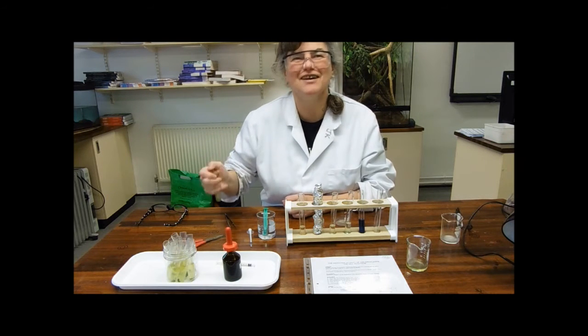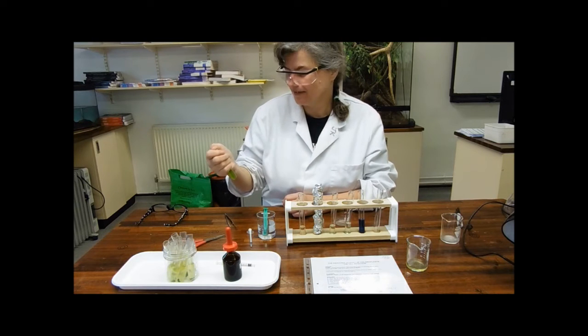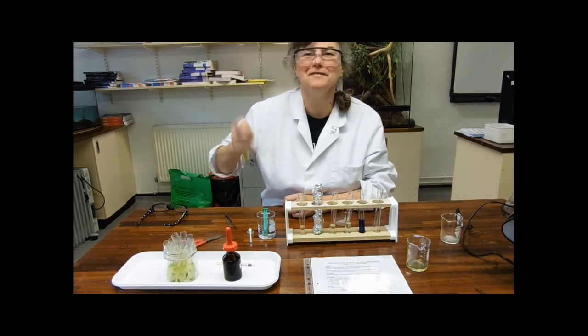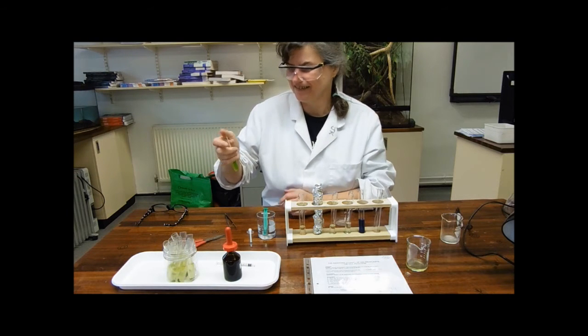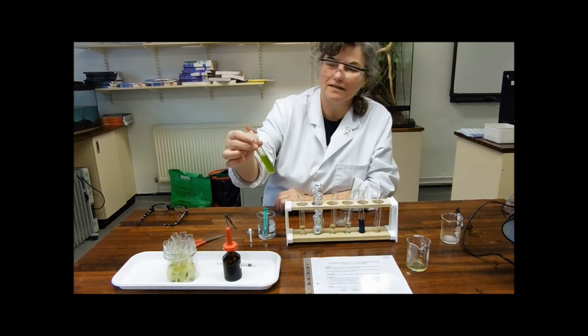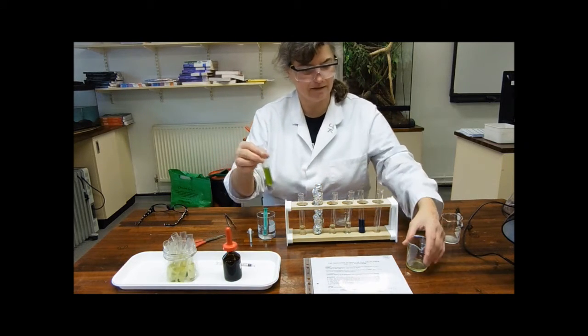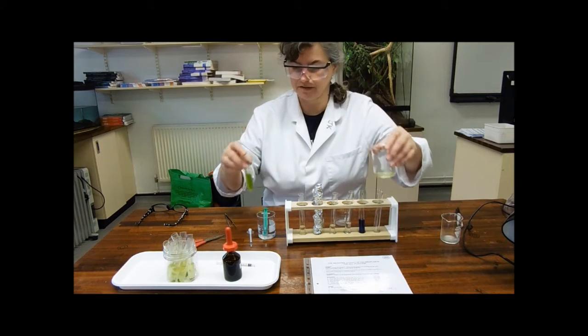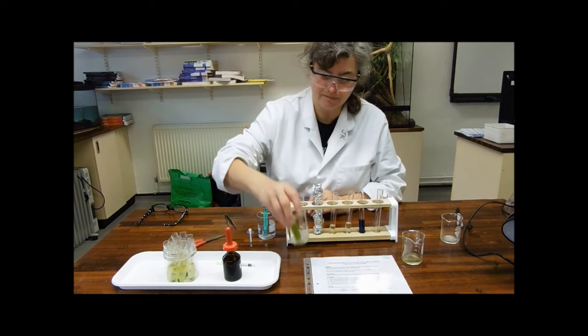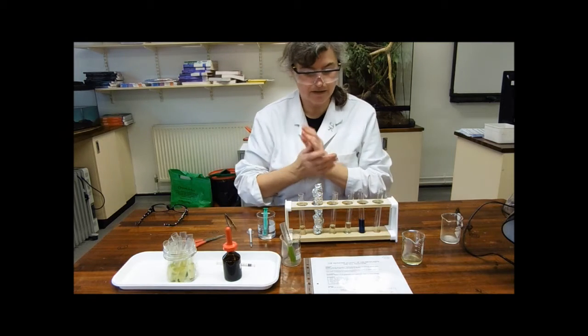What's a vortex machine when it's at home? Oh right, okay. You use one of those. Oh, hey. See, that's what being a doctor does for you. So in here I've got my nice suspension of chloroplasts and you can see that this is a much darker green colour than this one. So I'm now going to set up my tubes.